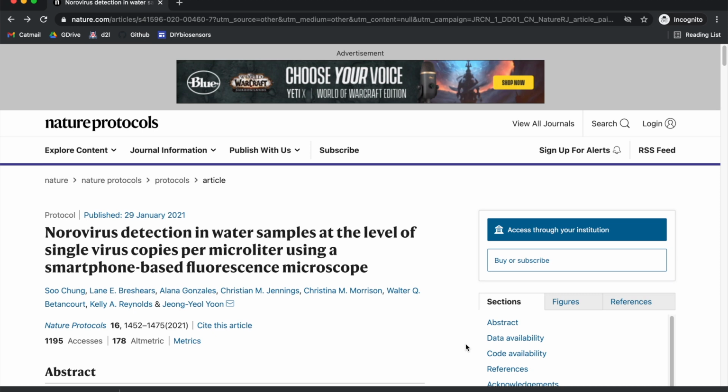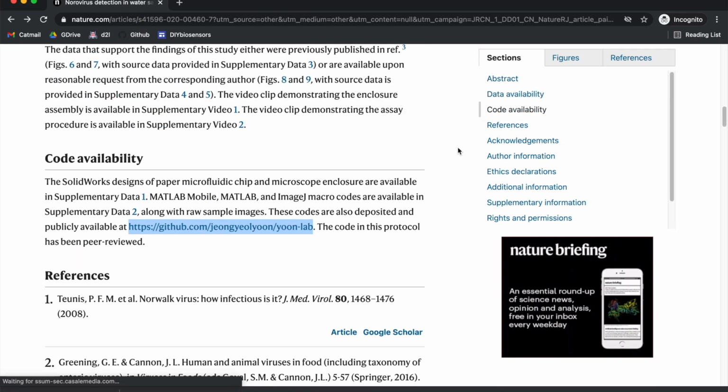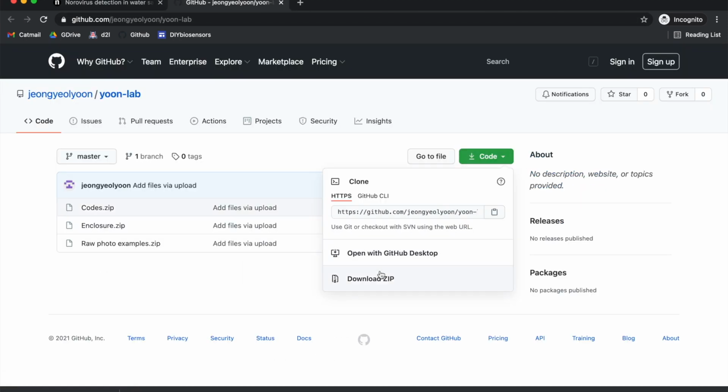So even if you don't have access, I can get in here. I'm in incognito right now because I just get automatically allowed in through the university. However, even if you don't have a school account, the code is still available. So just scroll right down here to code availability and go ahead and open that GitHub link and then download it as a zip file. I've already downloaded it, but it's not too big a file.